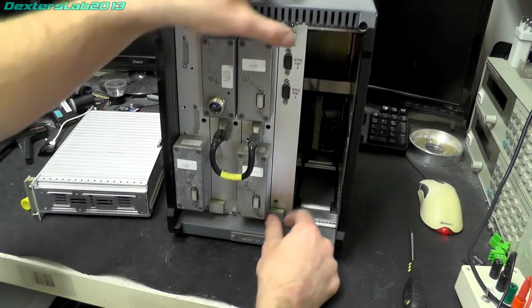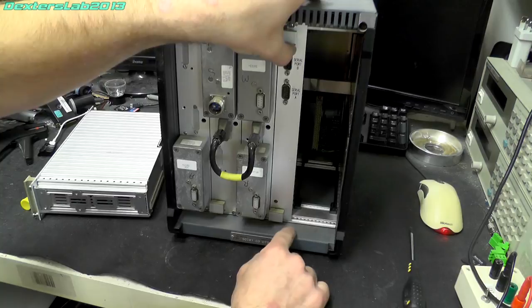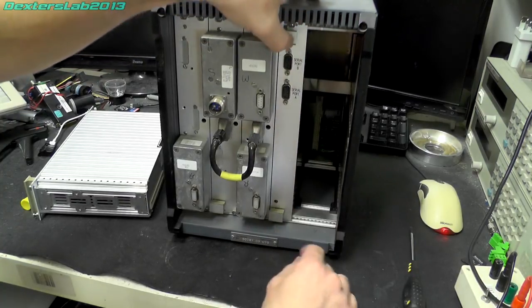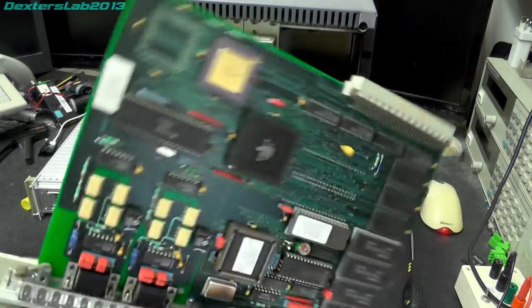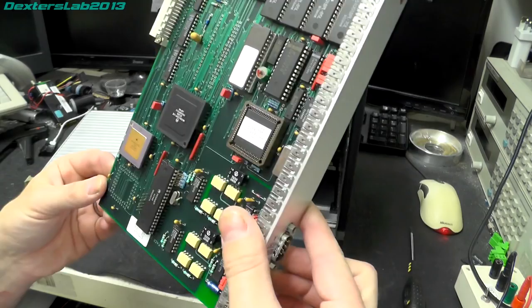Oh, nice. These actually have the pull tabs, which actually eject the card out. So these are, once the screws have been released, you can push them away and it pops the card out. Right. Oh.